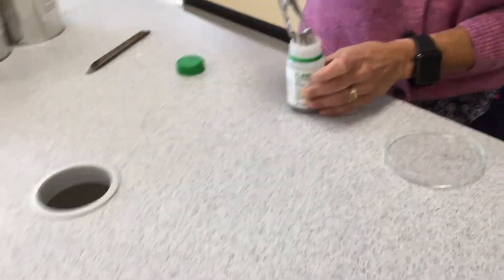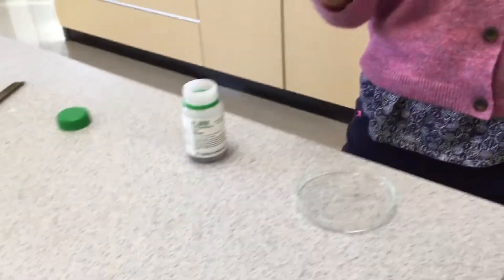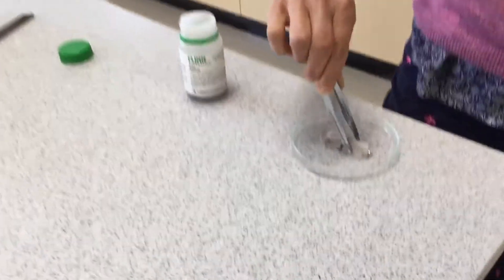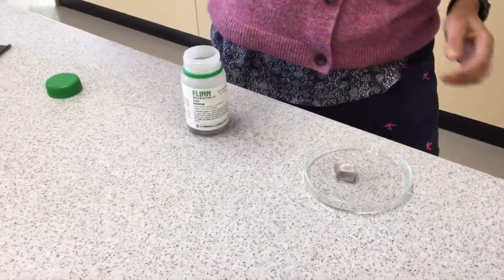Oh, that's sodium — awesome. That's a bunch of big chunks of sodium here. We are not going to do that big of a chunk of sodium. Let's put one back. And you guys will be able to answer why.